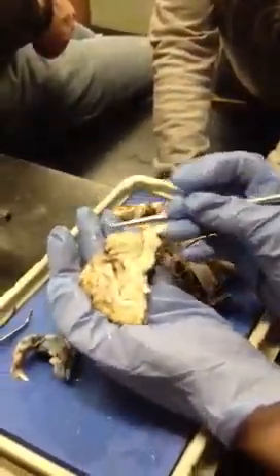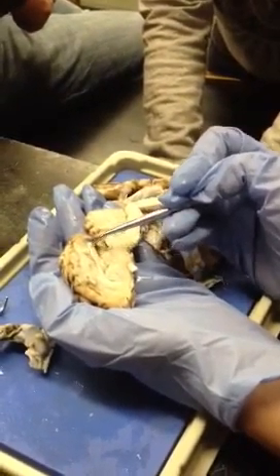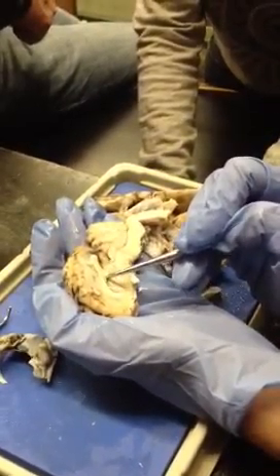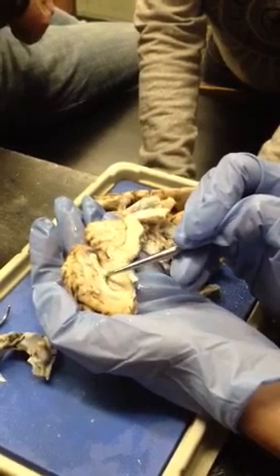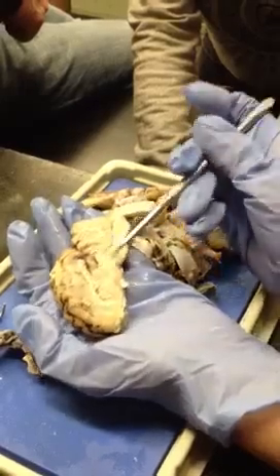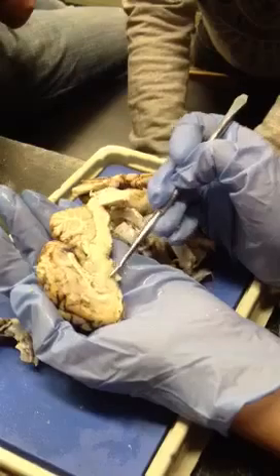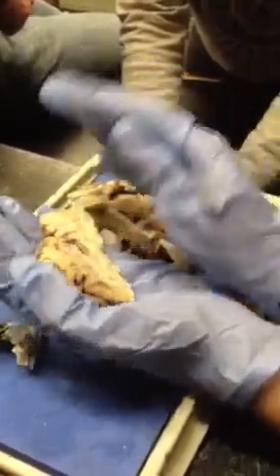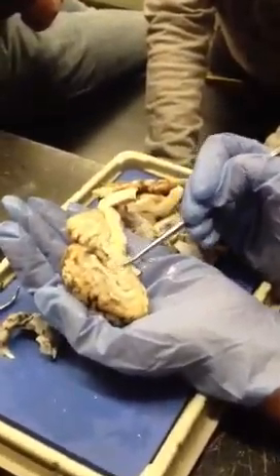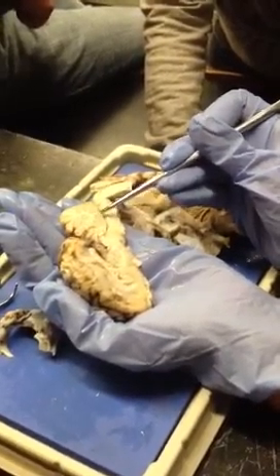Then looking here, corpus callosum. Then what's that? Fornix. Yep. Then if there was a membrane right here, what would that be? Septum lucidum. Right, which leads into lateral ventricles, one on the other side too, right? Then the third ventricle is going to be here if the brain were intact, but because it's formed by the two hemispheres, you can't really see it when we're only looking at half of them. But this is the third ventricle, and then the cerebral aqueduct here, and then the fourth ventricle is right here.